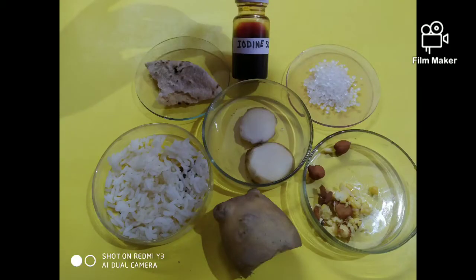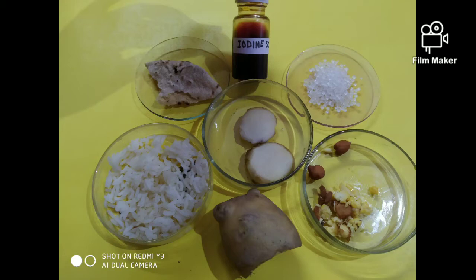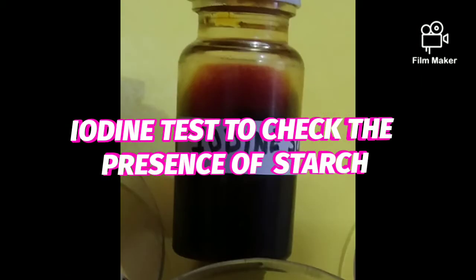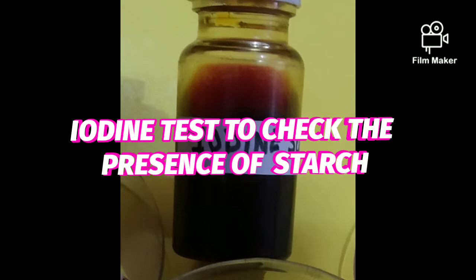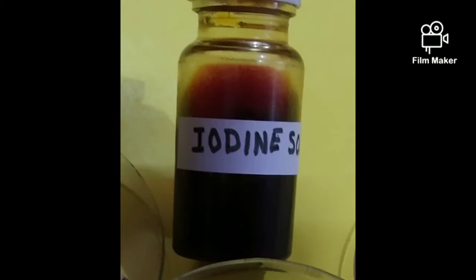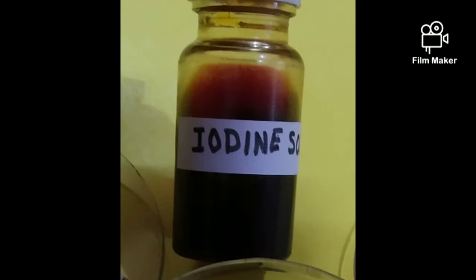Today we will check whether starch is present in a given food sample or not. This is checked by the iodine test. This iodine test can be performed for both liquid as well as solid food samples.